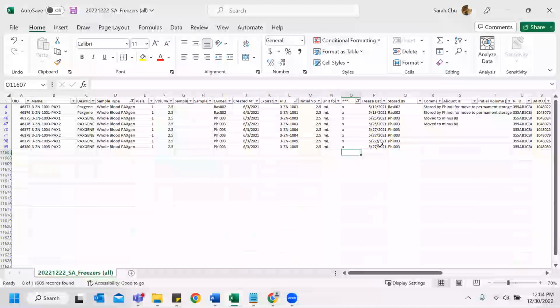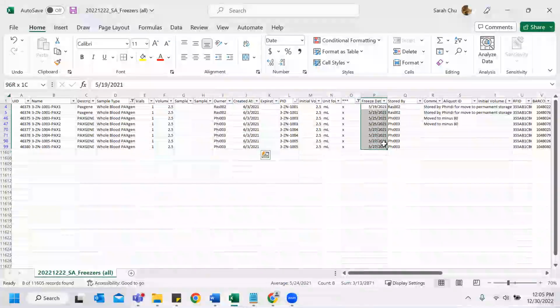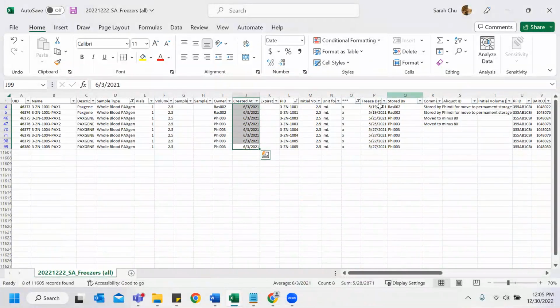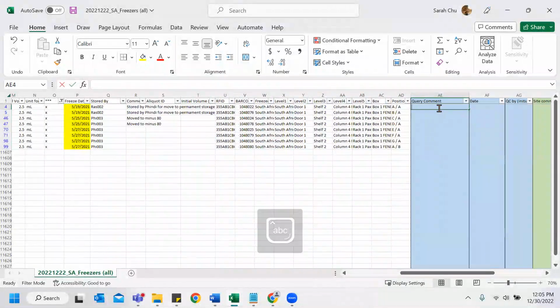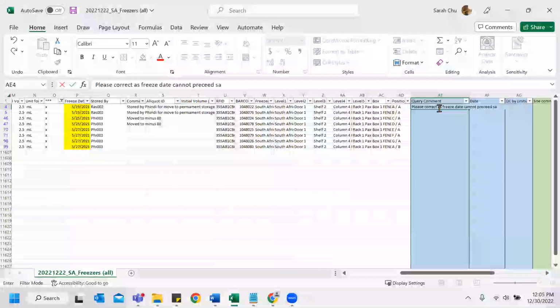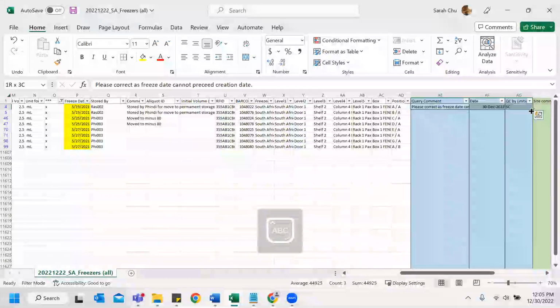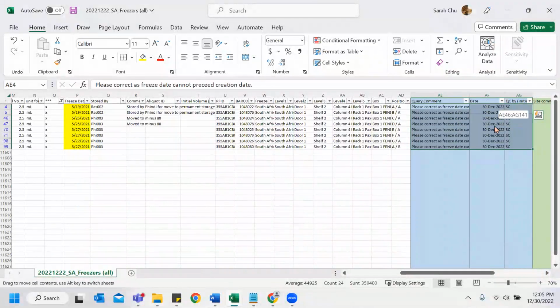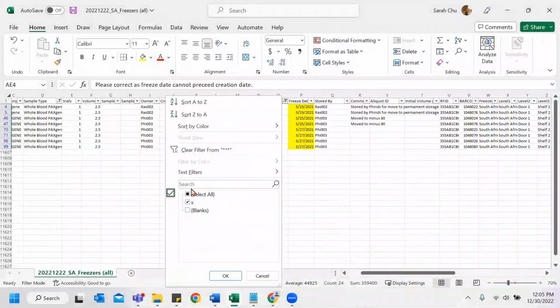And these all have freeze dates before creation dates, which doesn't make sense at all because you should have a sample created before you freeze it. So what I'm going to do is highlight this, say freeze date, freeze correct. When you drag, make sure the dates are the same when you drag them as well. And yeah, perfect.